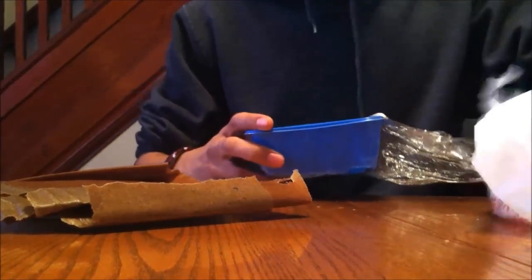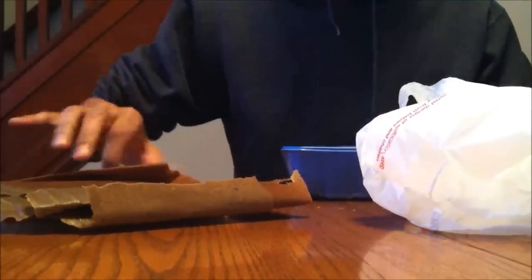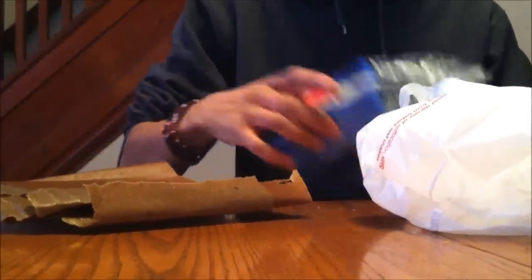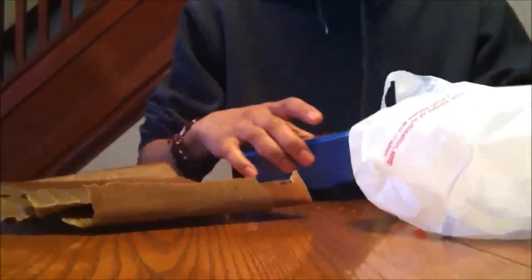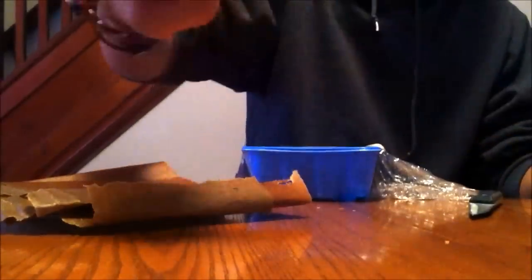All you need is the bag that the oyster mushrooms came in, some cardboard. We boiled some water and soaked this thoroughly, and a knife, and some rubber bands or twisty ties.